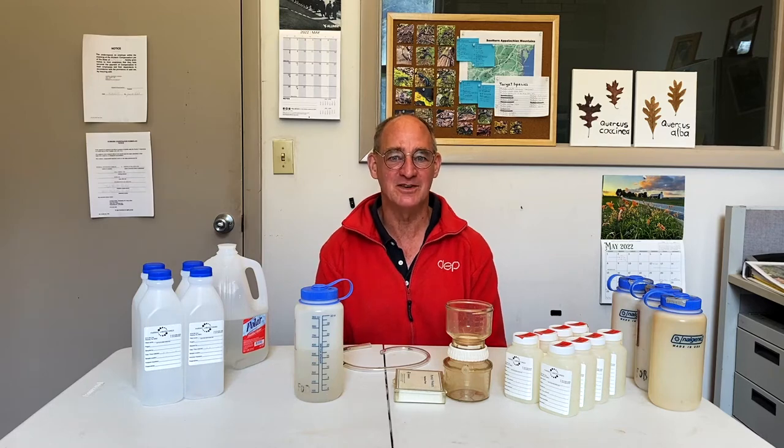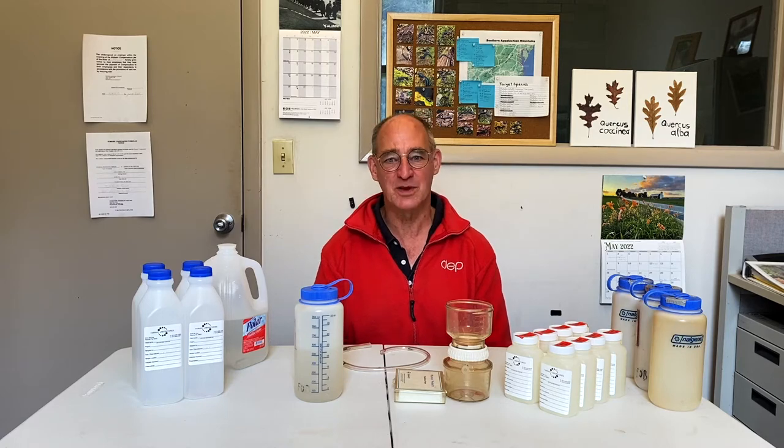My name is Martin Christ. I work for the West Virginia Department of Environmental Protection in the Watershed Improvement Branch. I'm here in the Buxton and Land Street building in Thomas, West Virginia with the Friends of Blackwater. And we're going to talk about sampling and processing water, especially sampling for the purpose of understanding acid mine drainage.